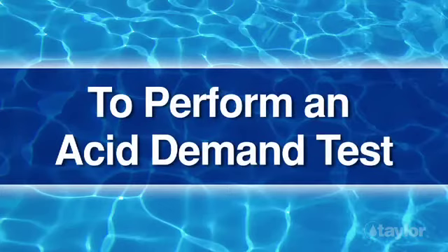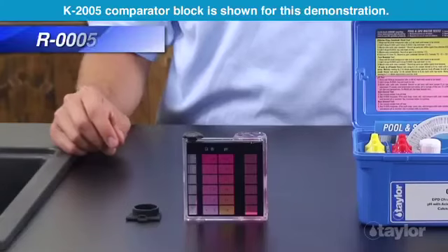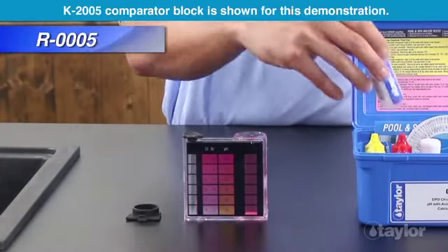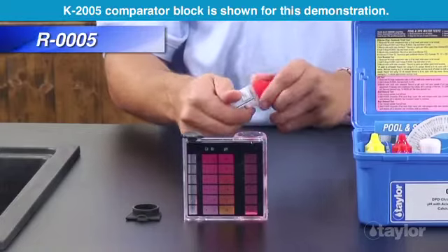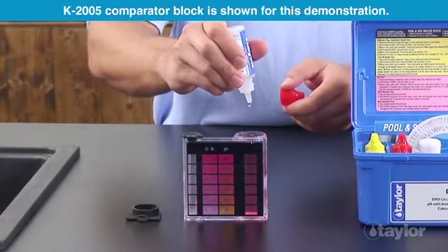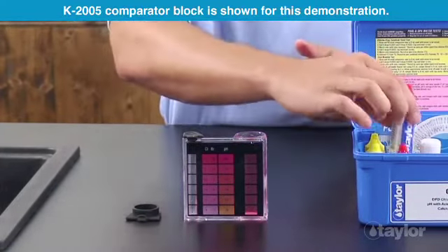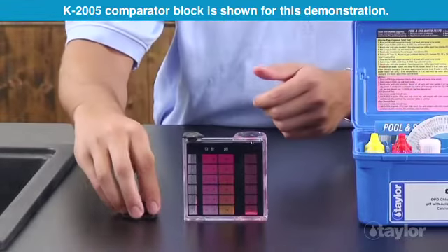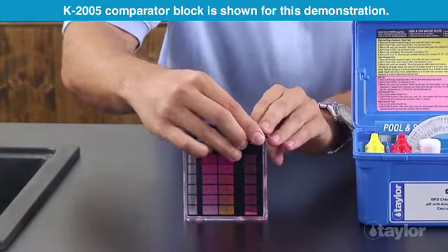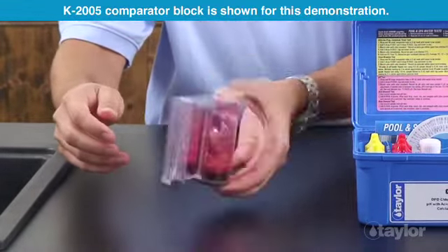To perform an acid demand test, use the treated sample from the pH test. Add Reagent 5 dropwise. After each drop, count, mix, and compare with the color standards until the desired pH is matched.